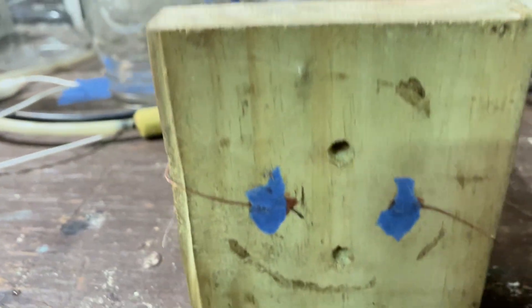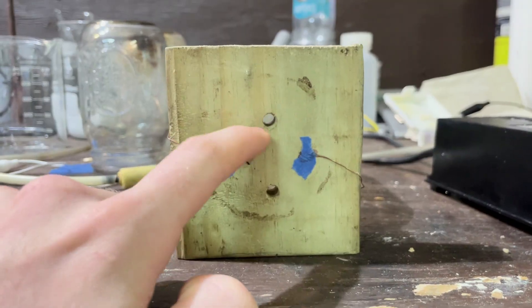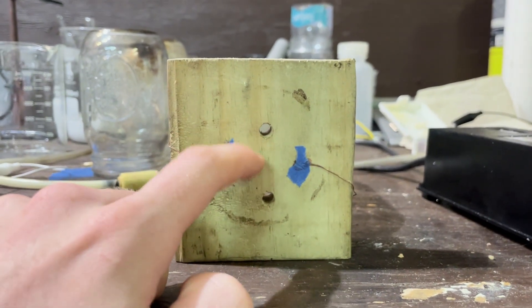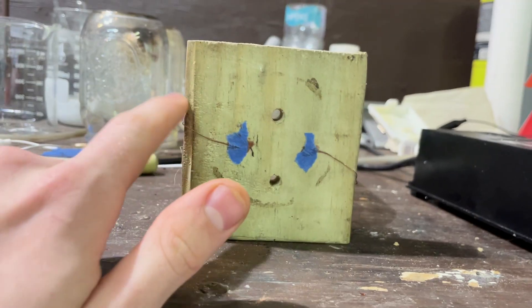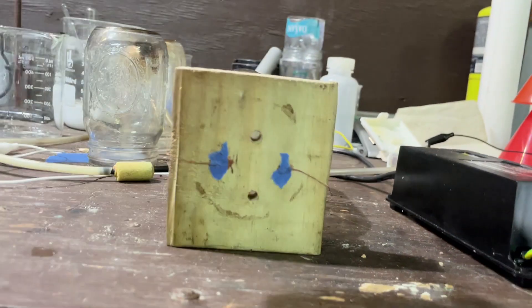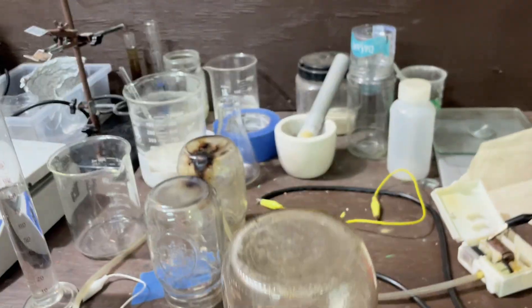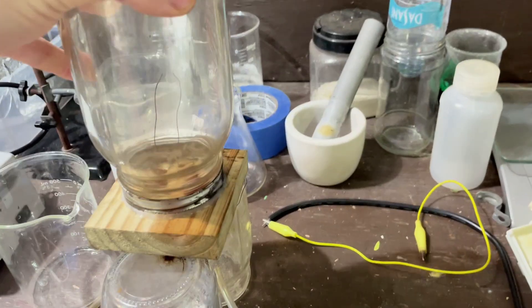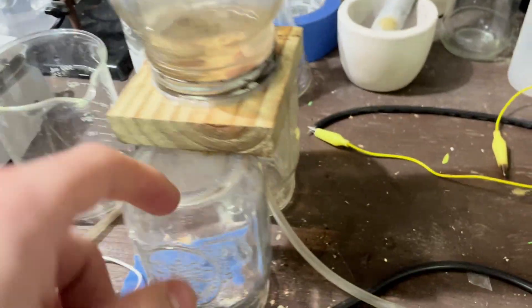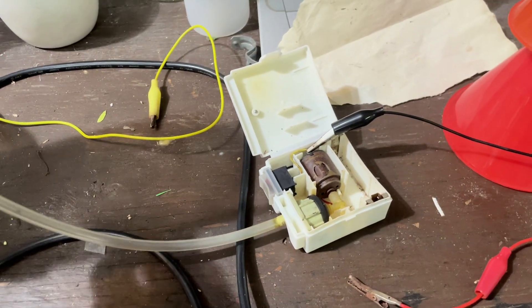Here's what it looks like from the bottom. I have an input hole for air, output hole for air, and my nitrogen oxide products. These are the holes I drilled for the wires. I have them coming out, put some tape and some wax in there to help seal them. So this is my chamber, and I'll be setting it up here for support on these two jars. I have my air from my very destroyed pump, and I have my bubble stone.